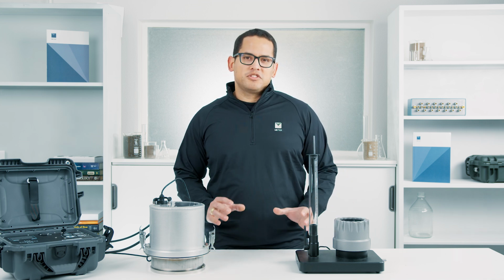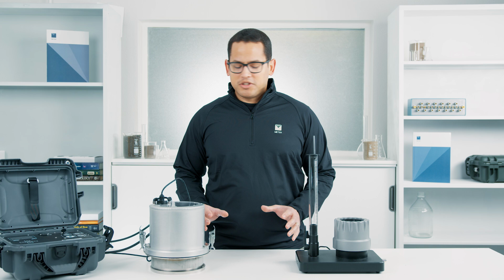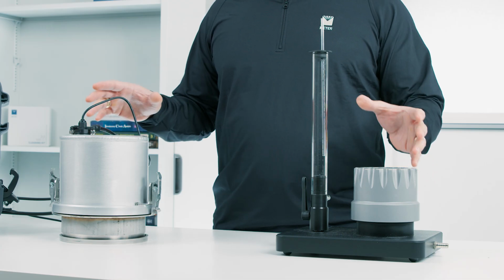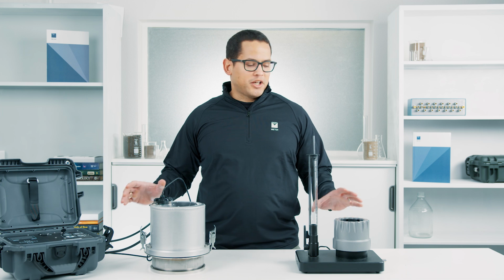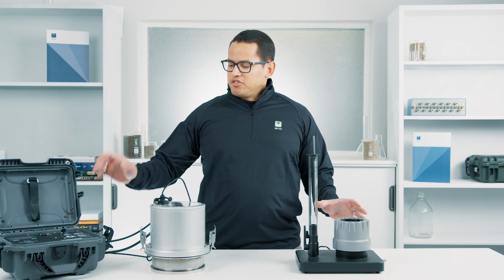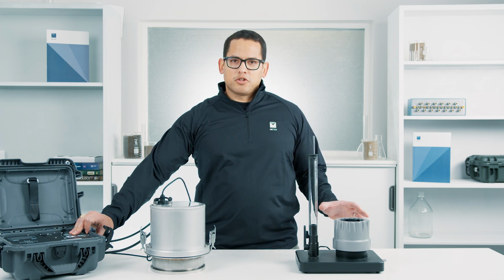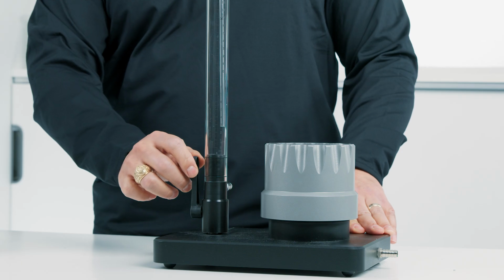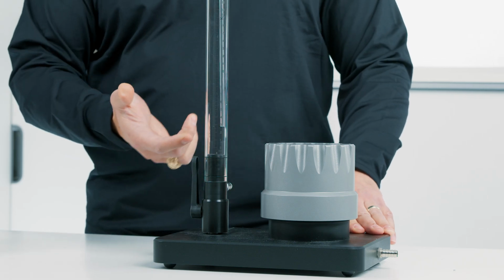And so there are a few differences that you need to understand about the two instruments, and there's pros and cons to both. With both of these methods, you're going to need a water supply to feed either of them. With the SATURO, it's going to be connected to this external port right here that's going to the water supply, and the KSAT is going to be connected to a reservoir in the lab right here that's feeding water.